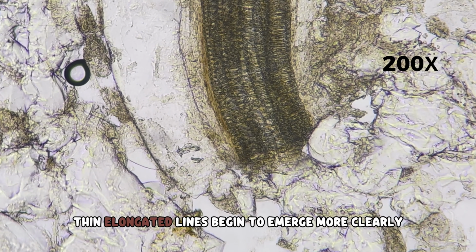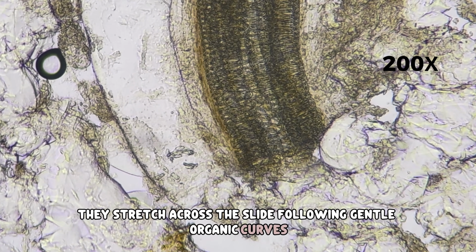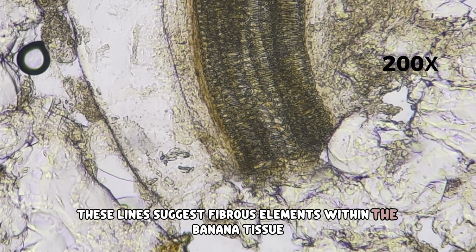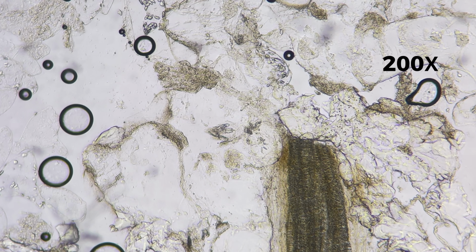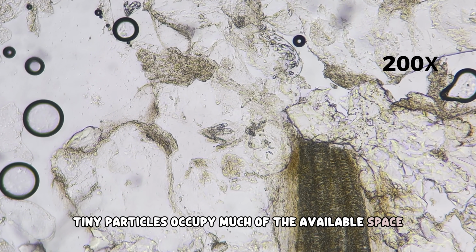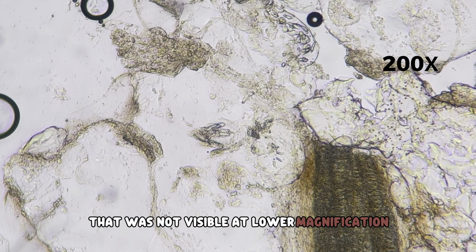Thin, elongated lines begin to emerge more clearly. They stretch across the slide following gentle, organic curves. These lines suggest fibrous elements within the banana tissue. The background becomes more densely filled with fine granules. Tiny particles occupy much of the available space. This gives the image a subtle texture that was not visible at lower magnification.